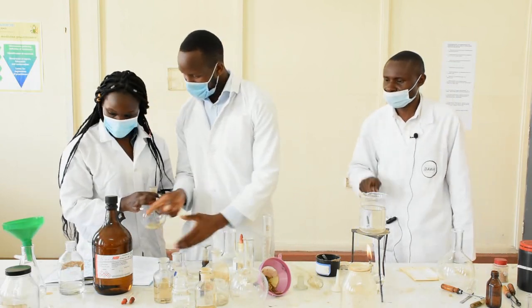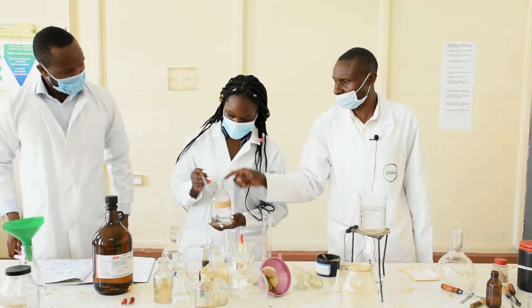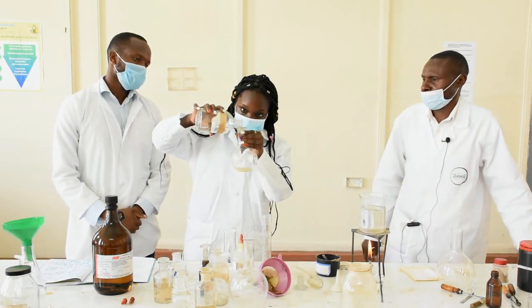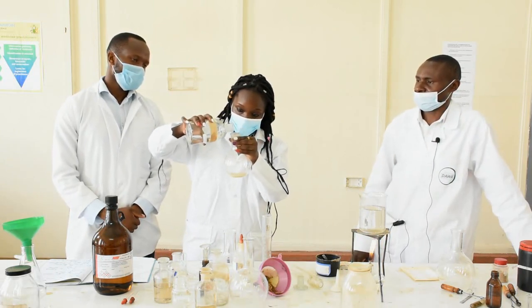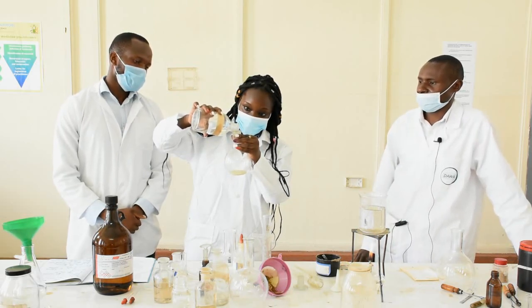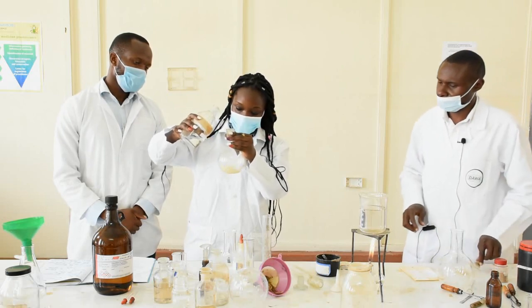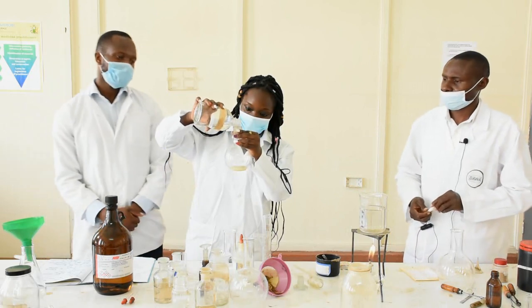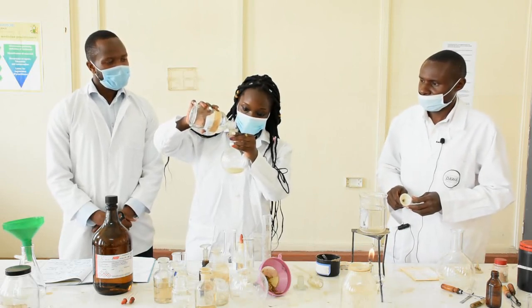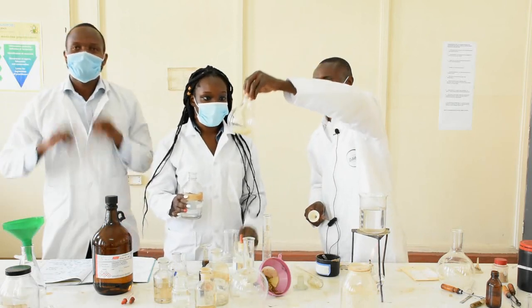You add 10% sulfuric acid to excess, shaking continuously, until the solution becomes clearer. Once it is clear enough, filter again — this time using cotton wool — to get a cleaner solution without debris, then place the filtrate back into the separating funnel for the chloroform extraction step.